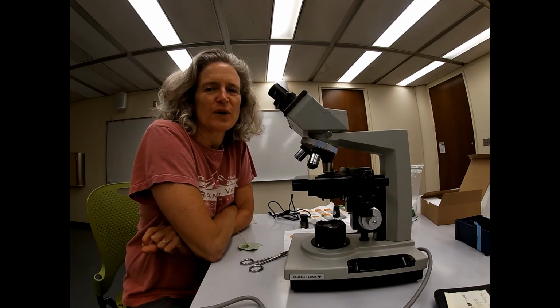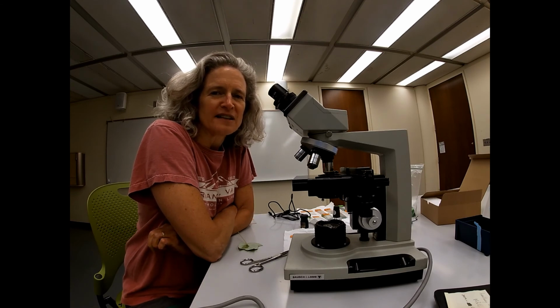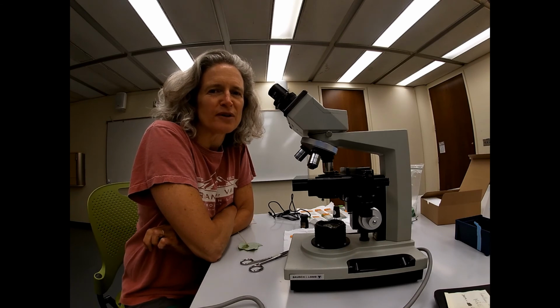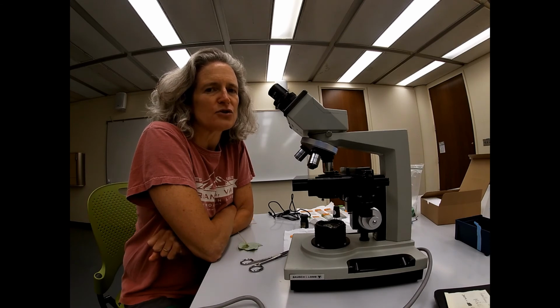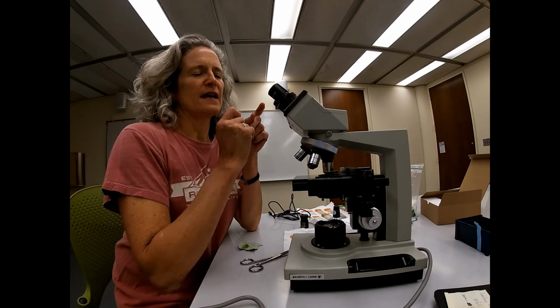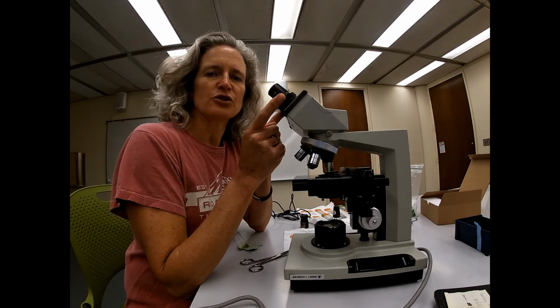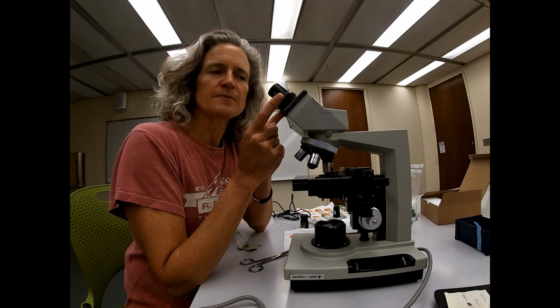Microscopes are a great way of seeing things close up, imagining life in ways that we can't imagine with our naked eye. You've all used microscopes before, and making sure you remember how to use a microscope is going to be key to being successful in this stomatal lab, which is going to be a 2- or 3-part lab for you. So we're just going to go over microscopes. You know that a microscope has 2 eyepieces that you look through. These are binocular microscopes. These are called oculars.